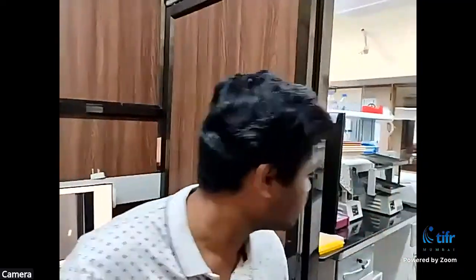Can we turn off the lights? Yeah, last switch. So this is a UV torch. So whenever we irradiate this, let's reduce the light further.